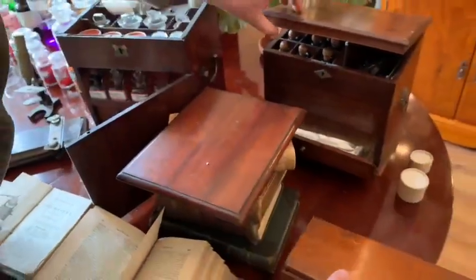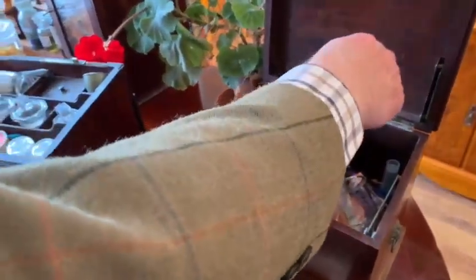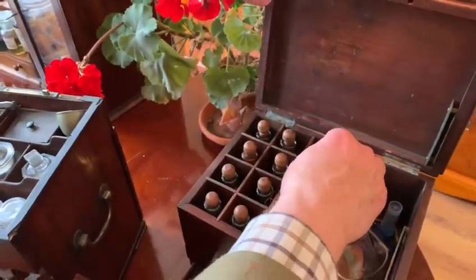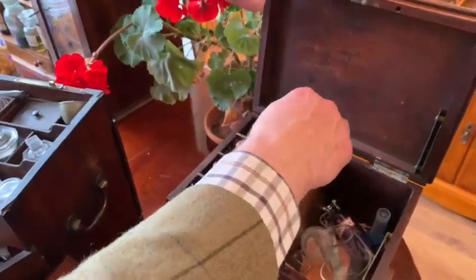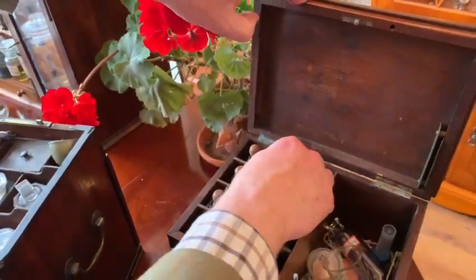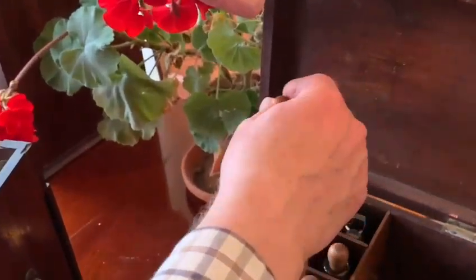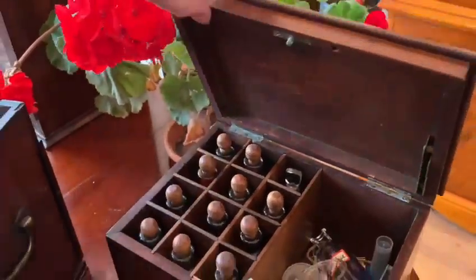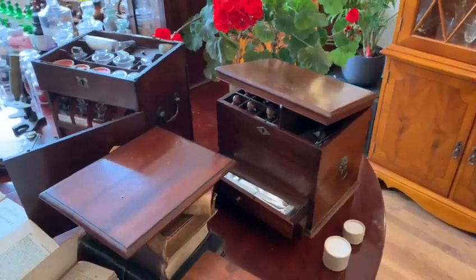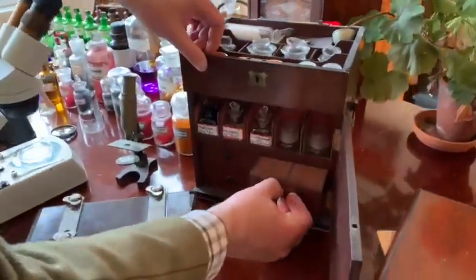Here is another little box that I would use. In it I would keep liquid stains — for instance, there's glycerine, which would be used to preserve specimens, some picric acid (thankfully in liquid state, not the explosive solid form), and eosin dye in alcohol. That would be a very useful little kit to bring out.